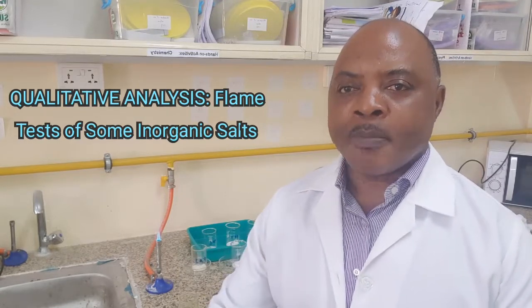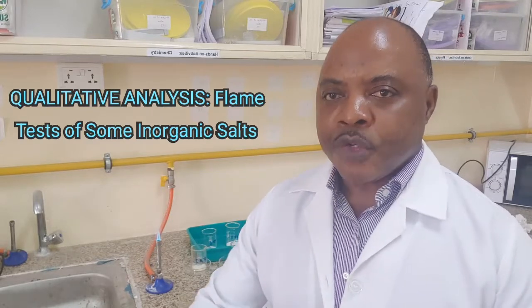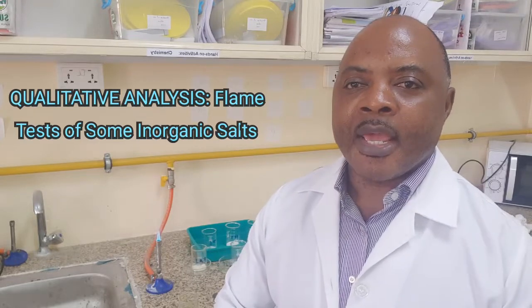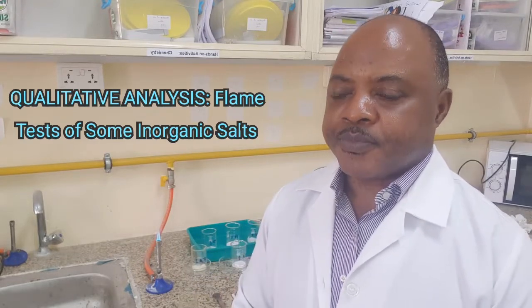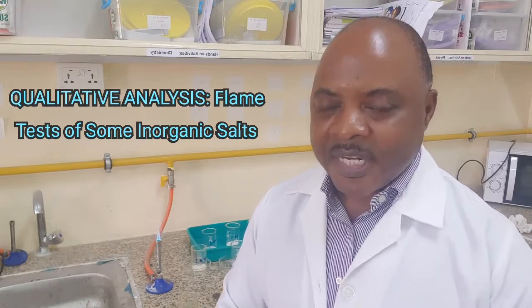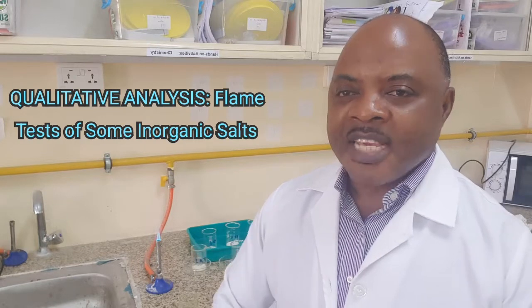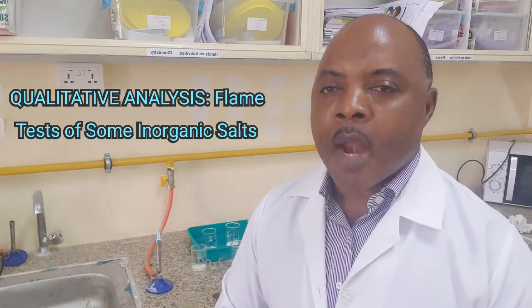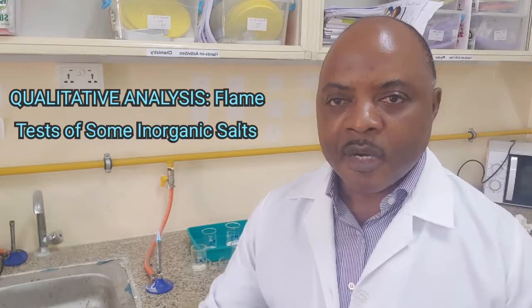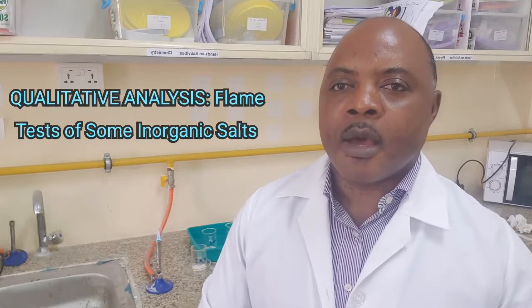In the course of the practical exam, there are some questions that will require you to determine the cation in an unknown salt. When you determine the cation in an unknown salt, automatically you know the metal that is present. And these are usually group 1 and group 2 metals. When you determine the metals, that will now be used in other sections of the question.